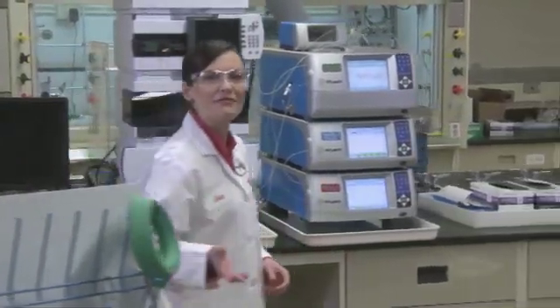It's amazing what you can find when you take time to look. And although that may sound mysterious, it's actually the focus of this session in our video series on laboratory safety. Today we focus on inspections by outlining the procedures that are common to lab inspection programs.